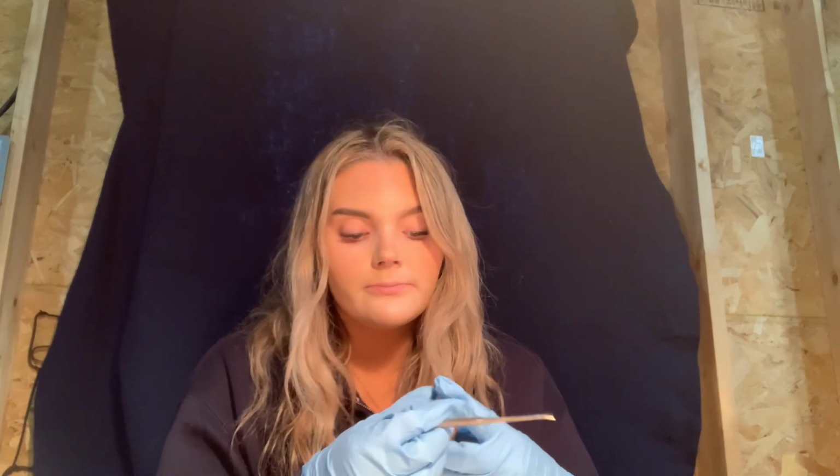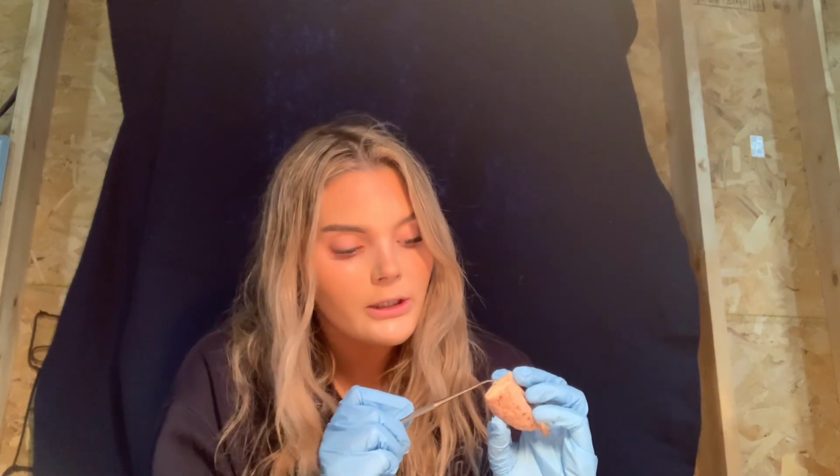And we also have the diencephalon, just go down over here. It is the region of the brain that is made up by the thalamus and then the hypothalamus over here. And we have gray matter. So here is the gray matter. I opened this so you can see the gray matter here. And it is the area of the spinal cord containing cell bodies, dendrites, and unmyelinated axons.